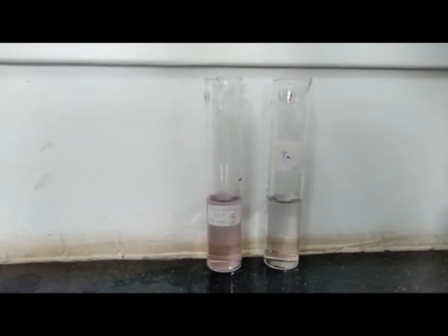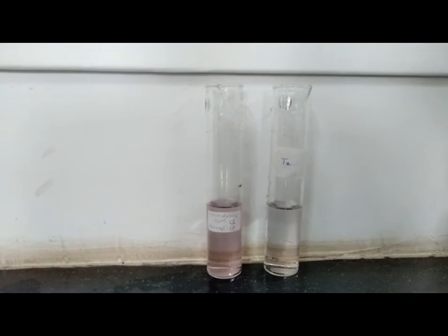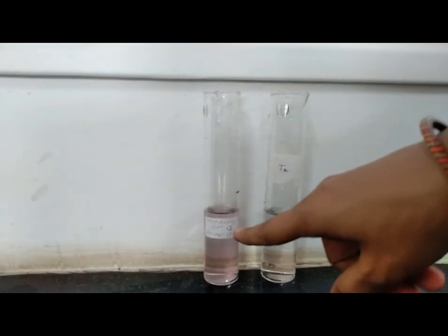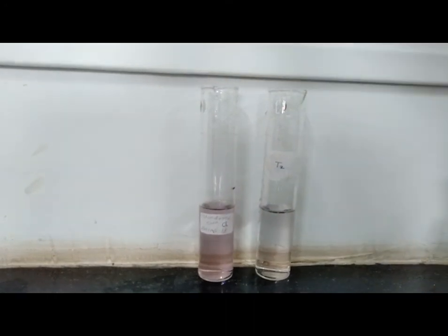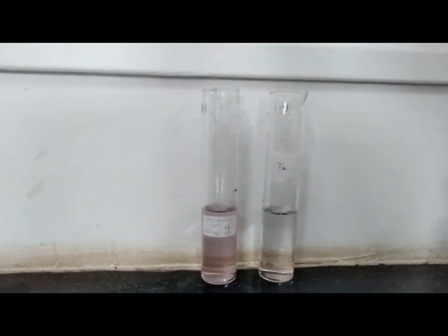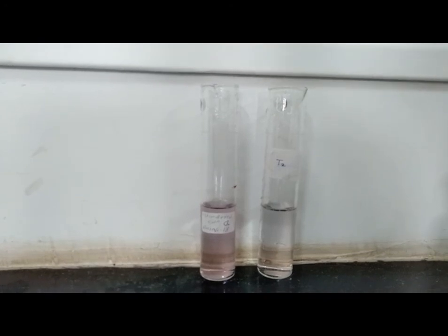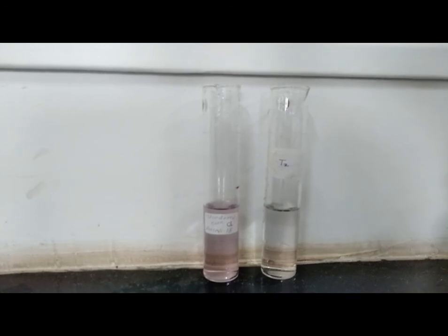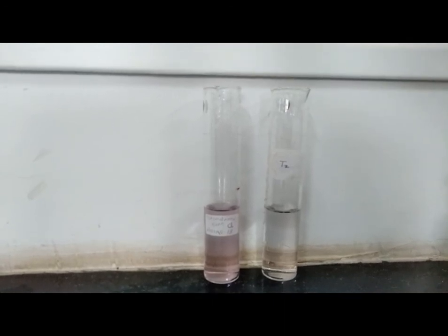Now, view the color intensity against a white background. Observation: the color intensity produced in the sodium chloride test solution is less as compared to standard solution. This is our standard solution which shows purplish color. And this is the test solution. As compared to standard solution, here the color intensity is less. That means the given sample of sodium chloride complies with the test as per Indian Pharmacopoeia for limit test of iron.